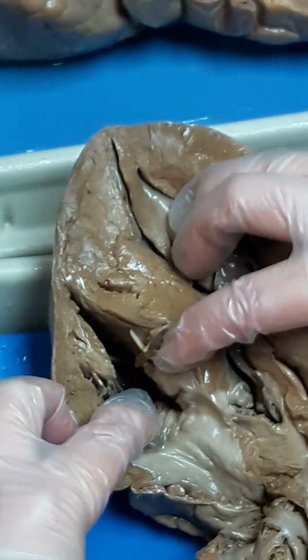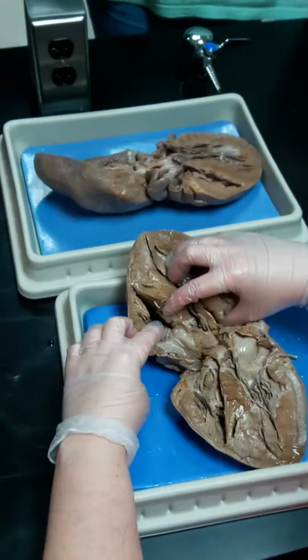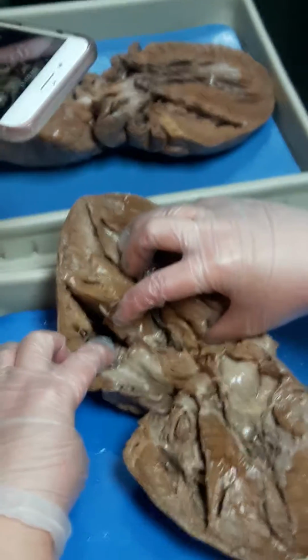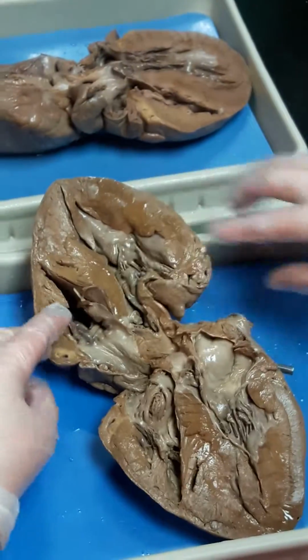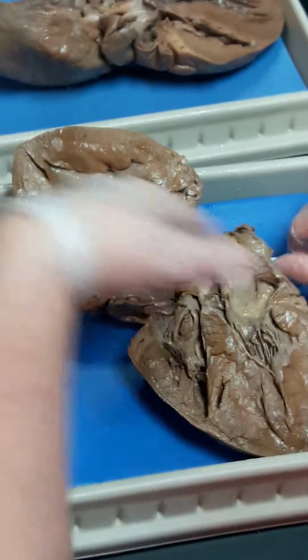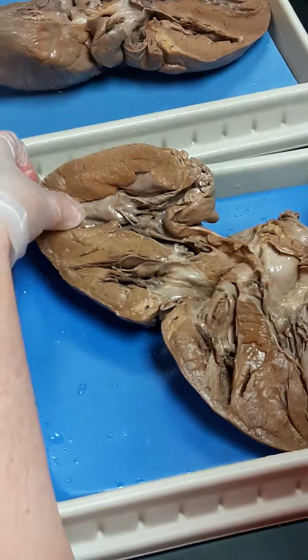I've passed through the pulmonary semilunar valve. There is no way you can spot it, right? Way down in there. The pulmonary semilunar valve and pulmonary artery are great questions for the model that's sitting at the back of the room. Hint, hint. But you see how I have the probe in the vessel. Anytime I'm doing these vessels, the probe will be in it, so you can figure out which chamber it's going to.